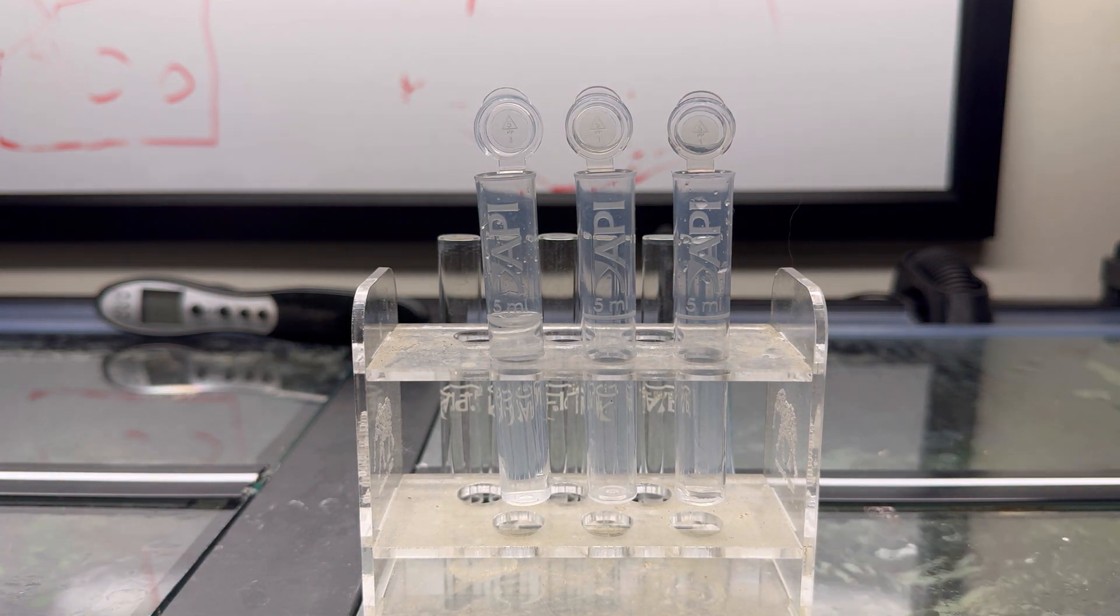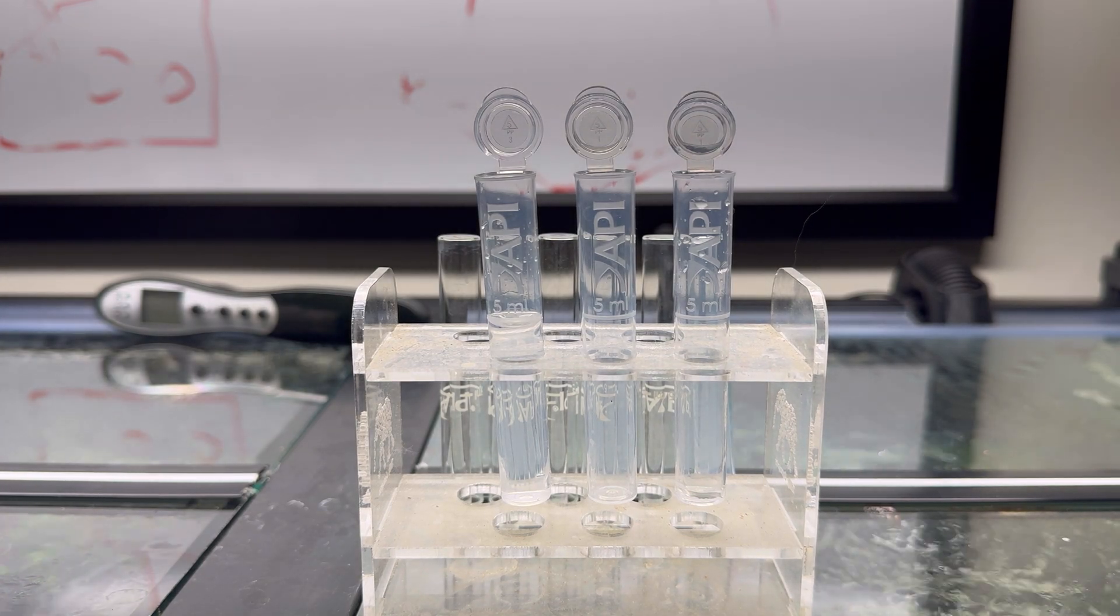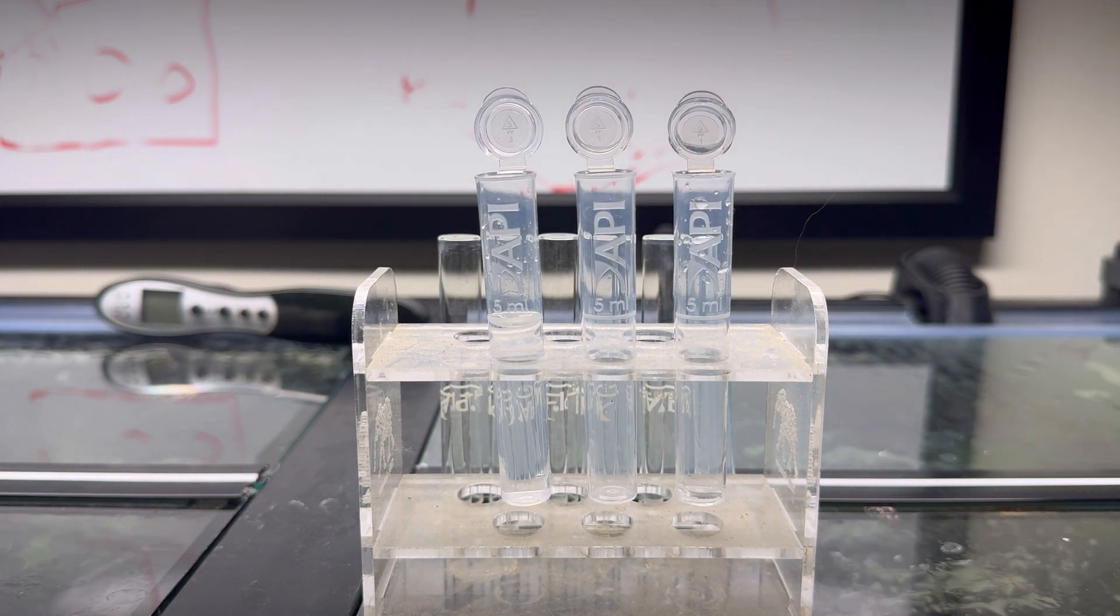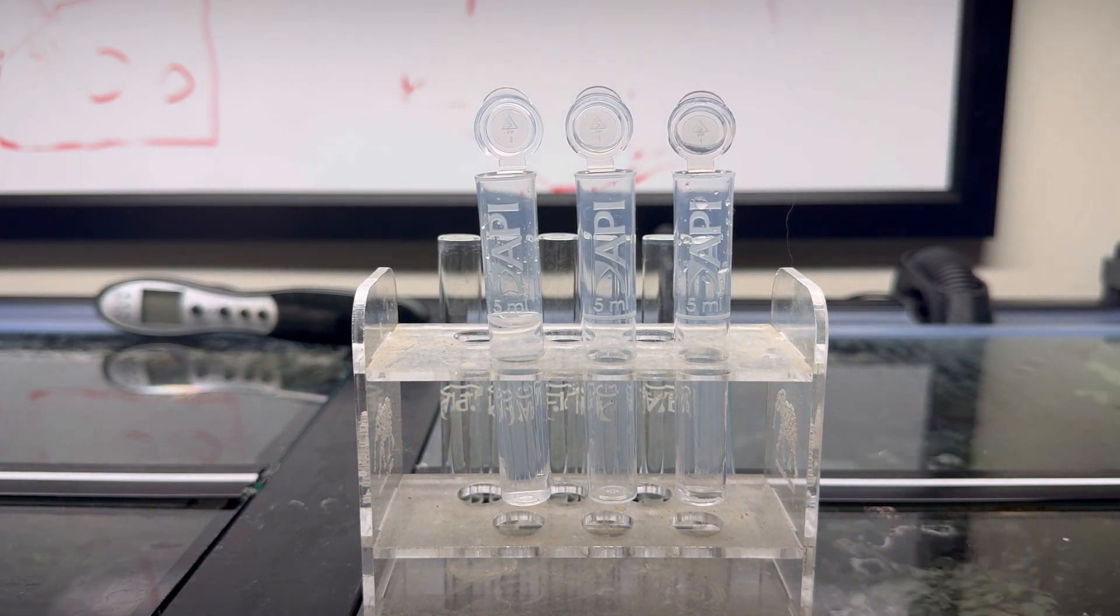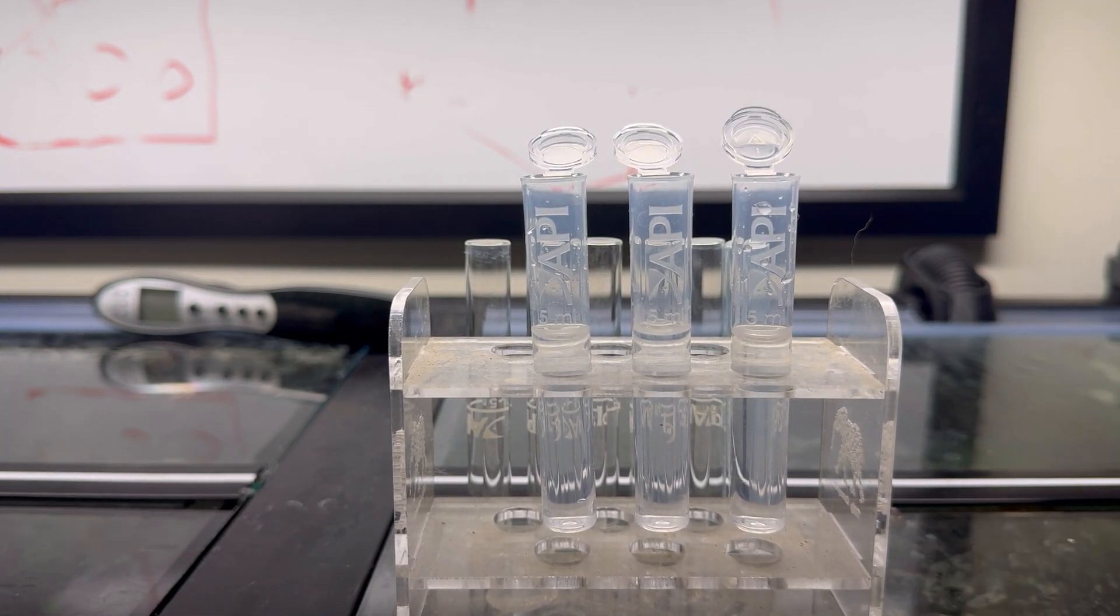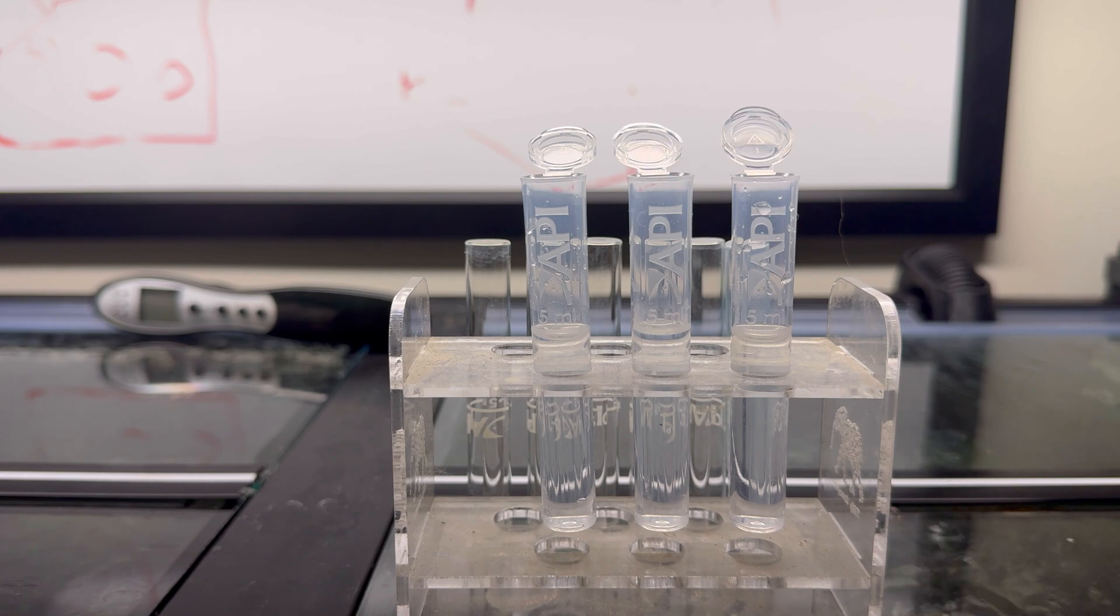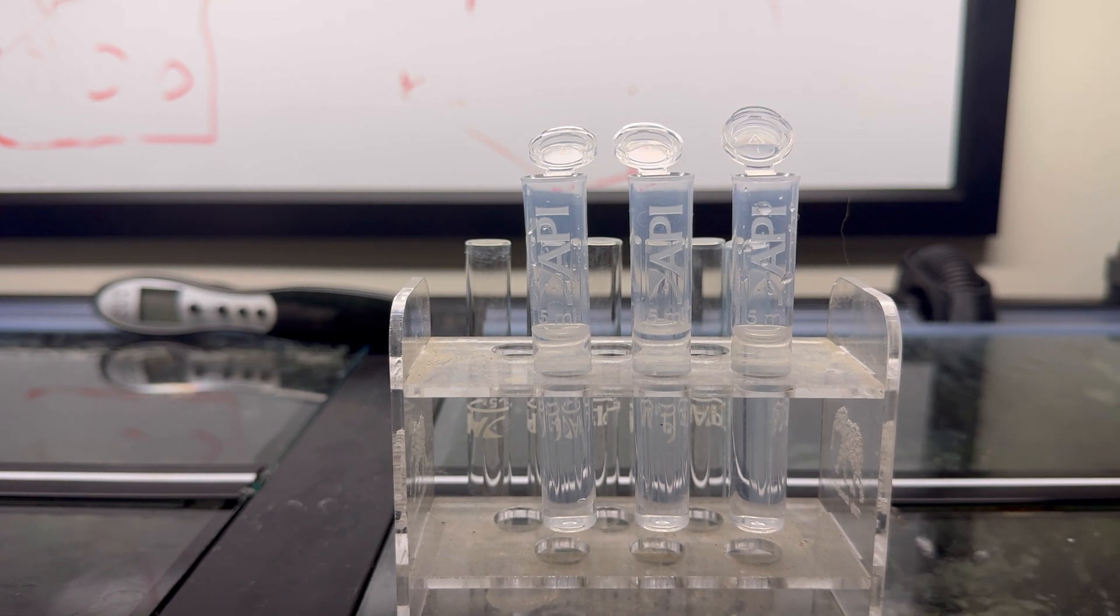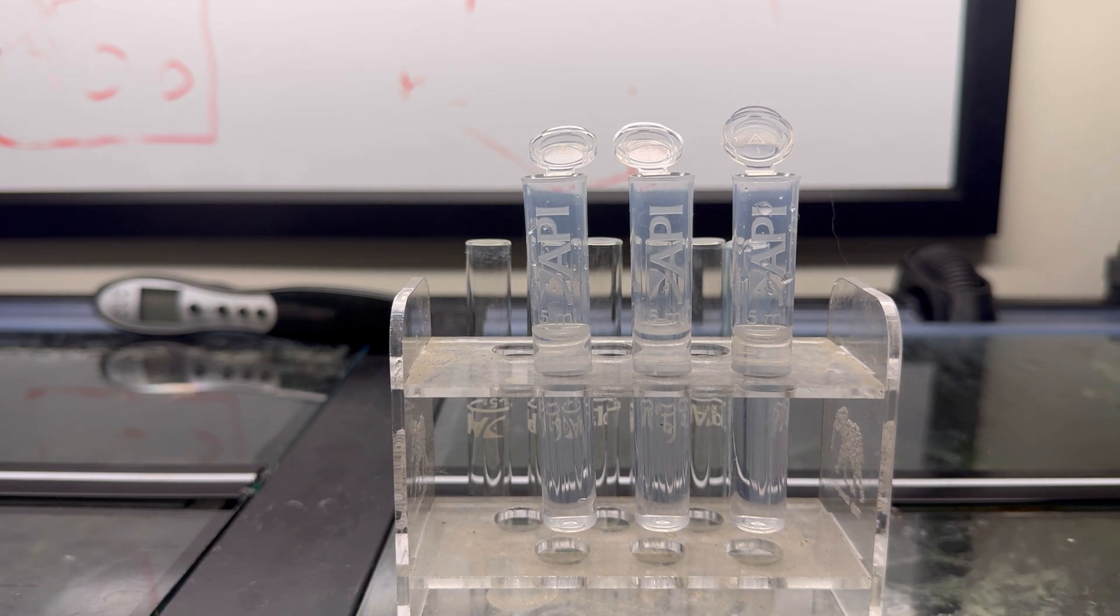For the sake of the video, we're going to skip the rest of this and just cut right to them being filled. One quick thing to mention when filling these vials is to grab your water from the cleanest part of your tank, most likely right around the outflow of your filter, so you keep as much sediment out of the vial as possible.